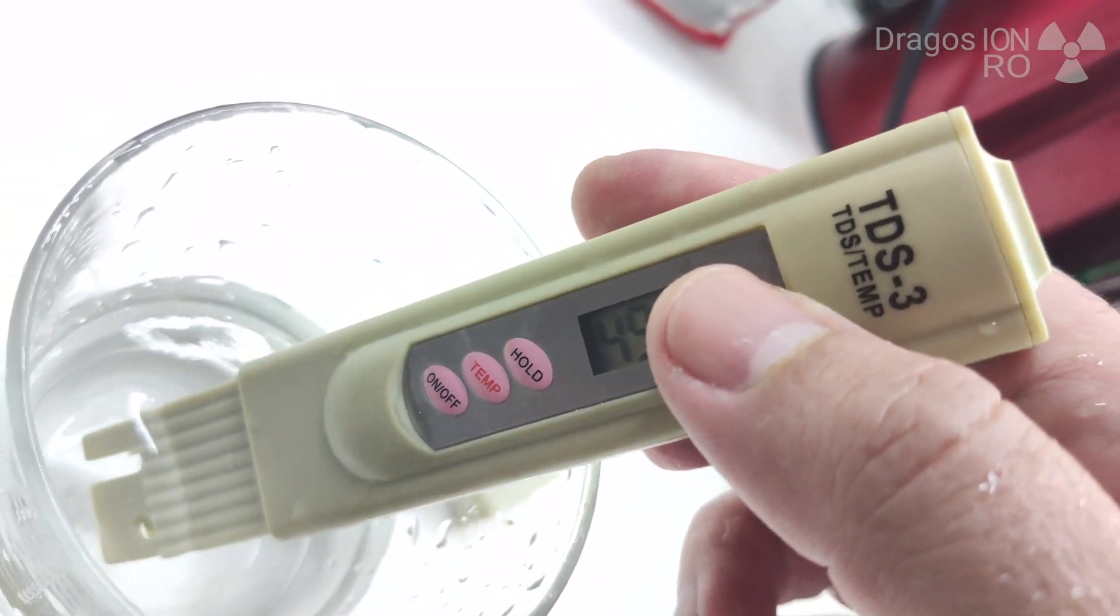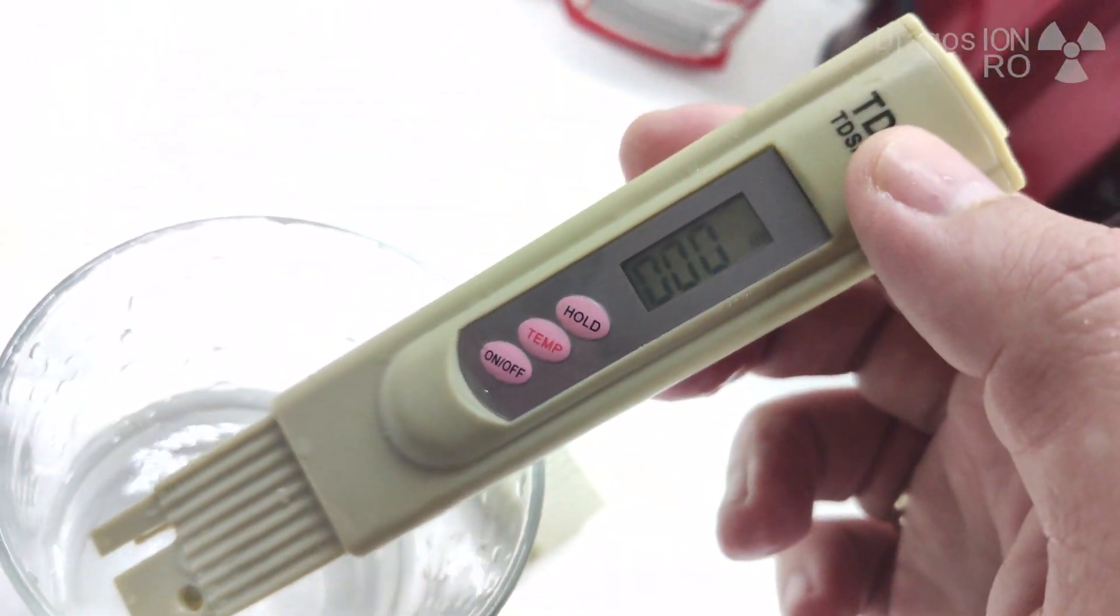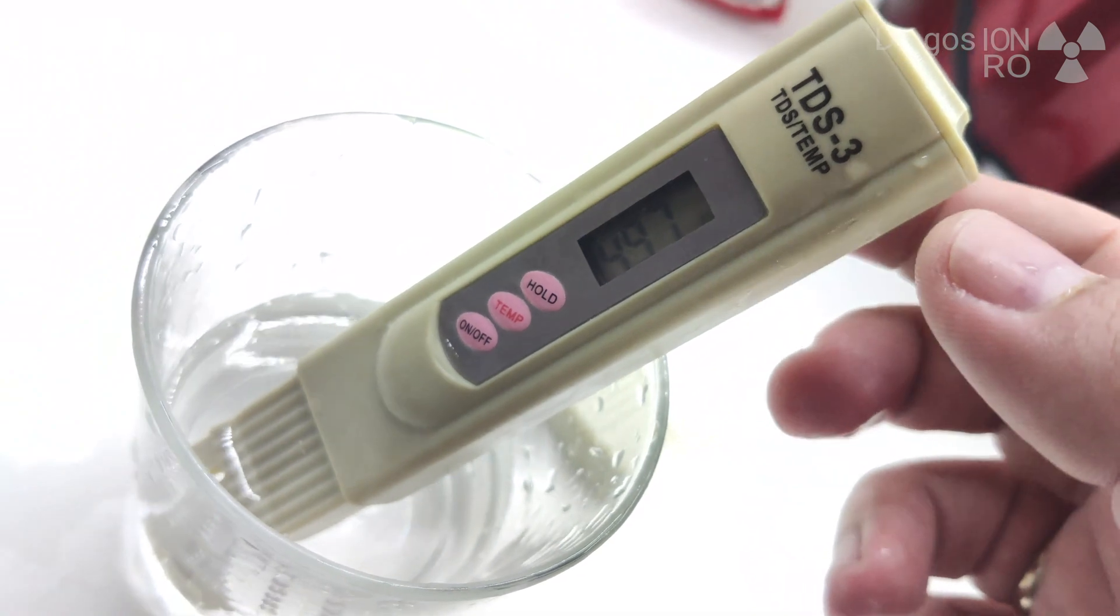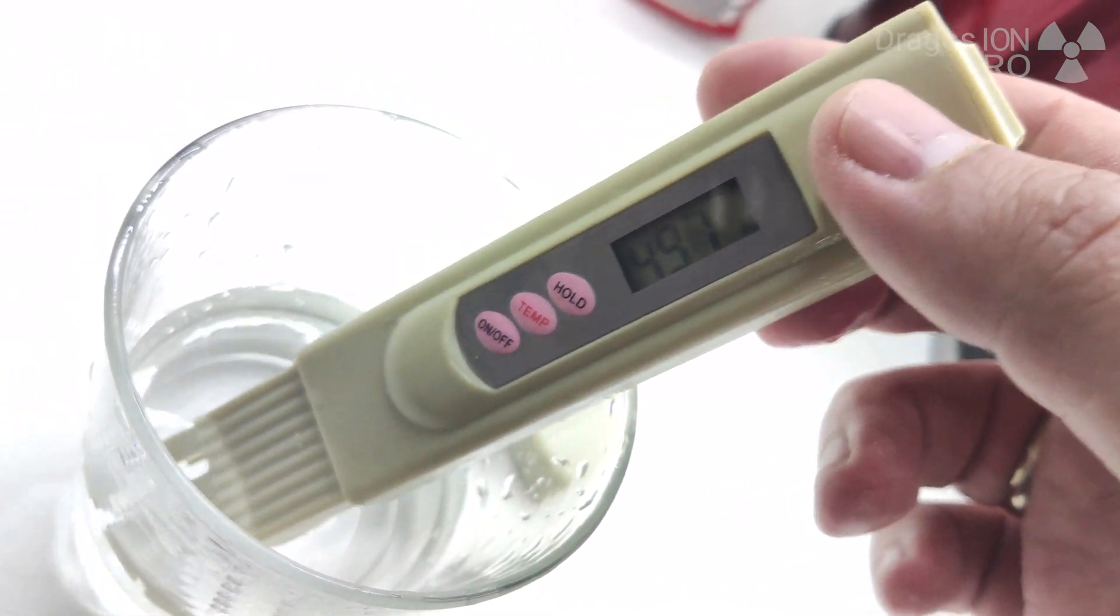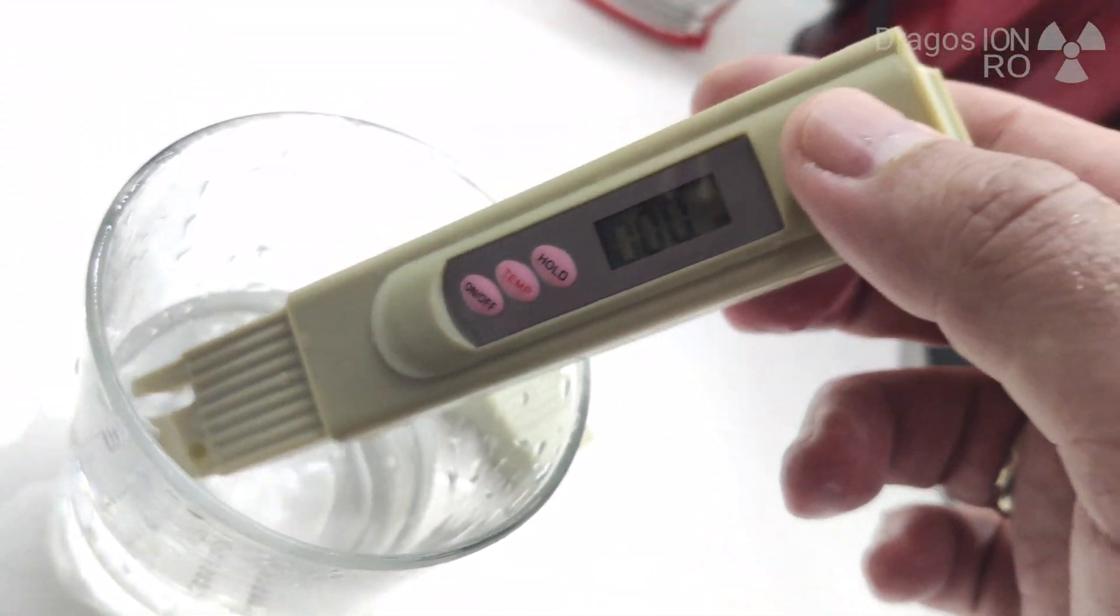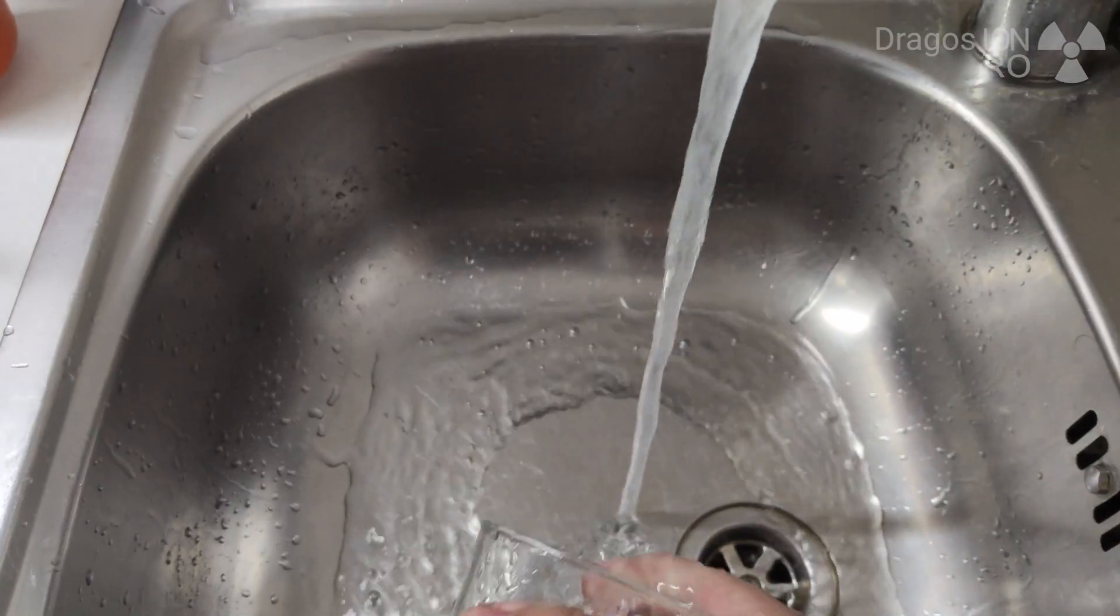And this is the tap water, and the value here for my tap, you have to put it in the water, it's about 497, 500. It's around 500 from the tap, so it's not great but okay, it's acceptable.